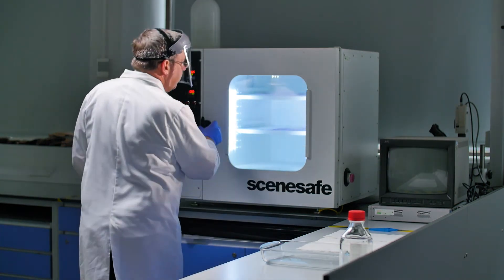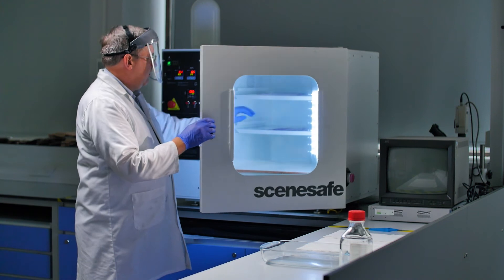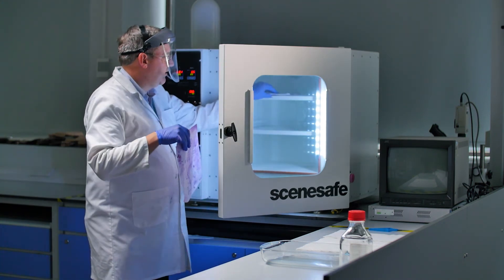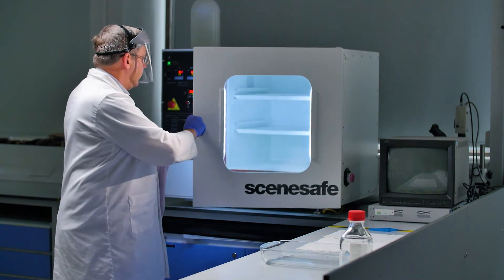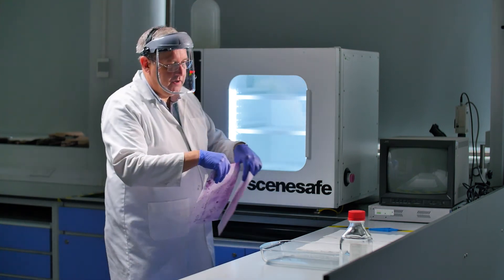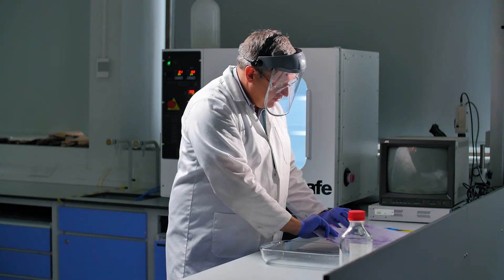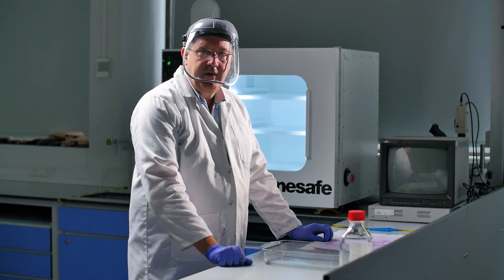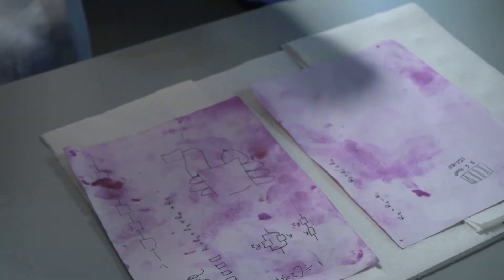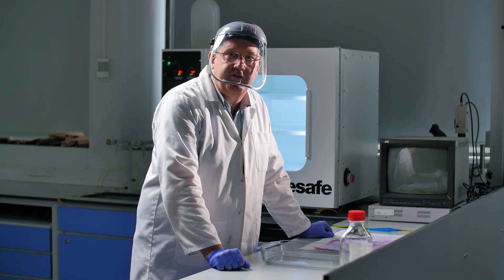So I'll open this oven and there we go. We've got a lot of fingerprints developed on these pieces of paper, so very successful.